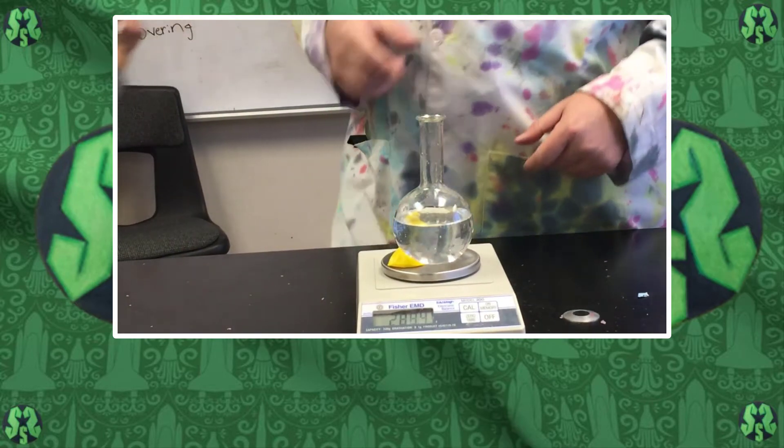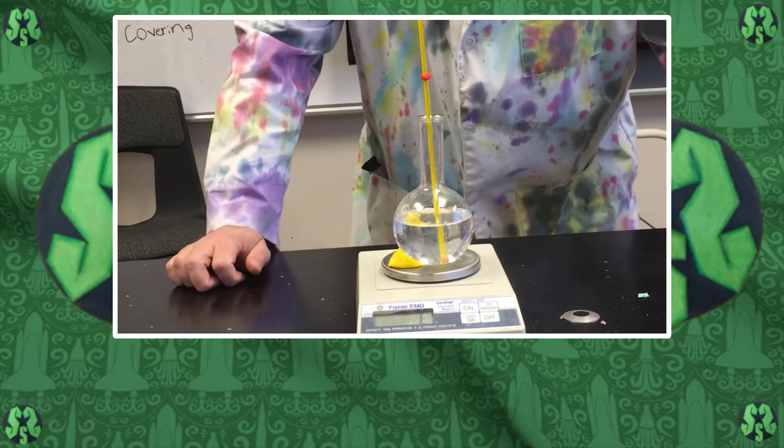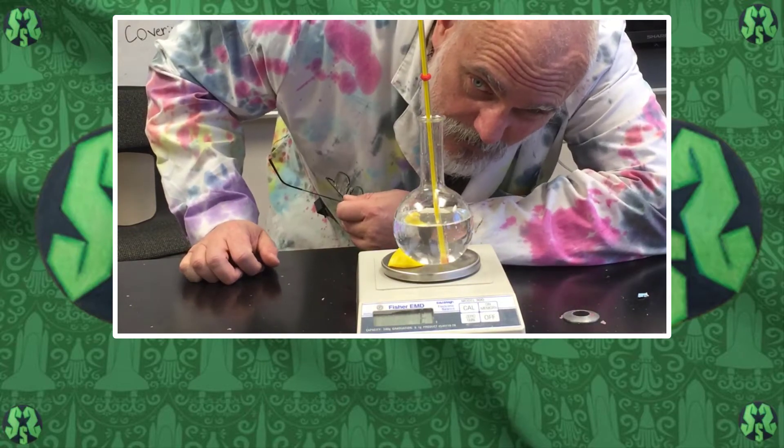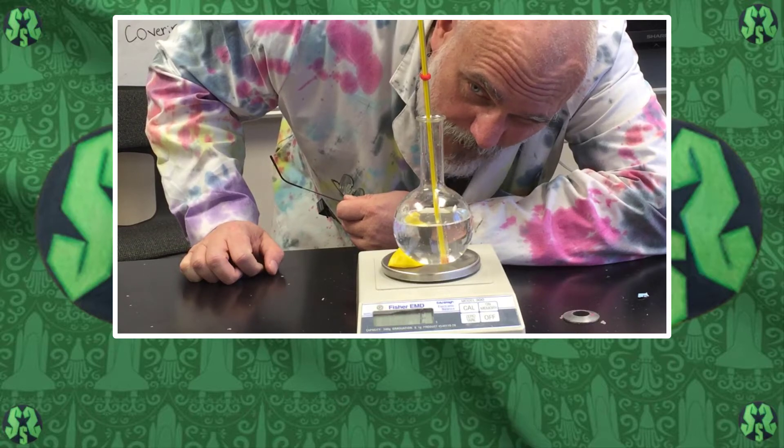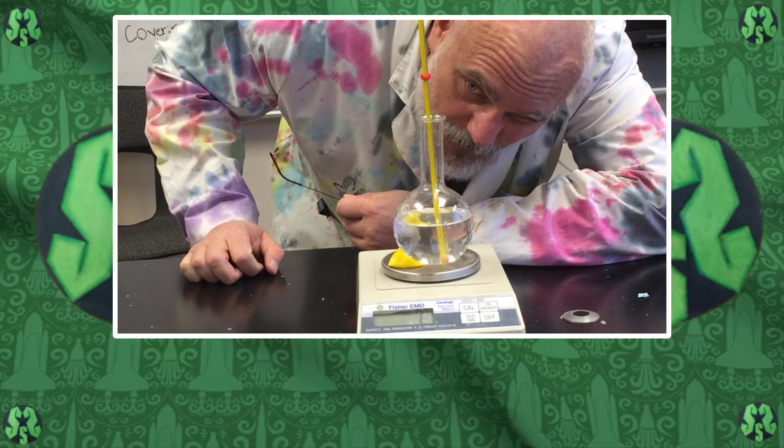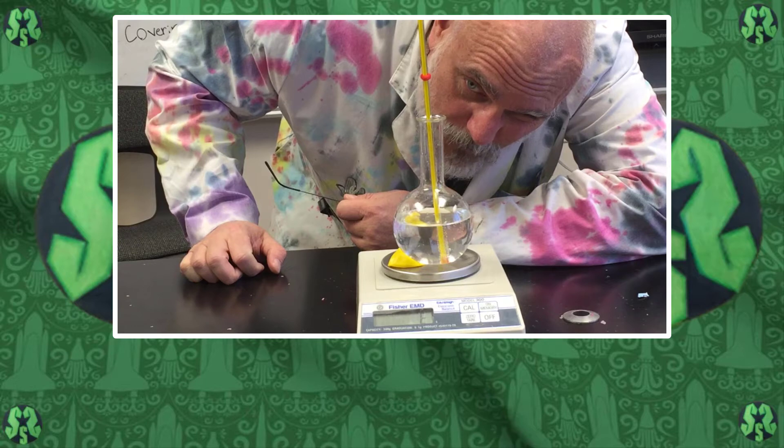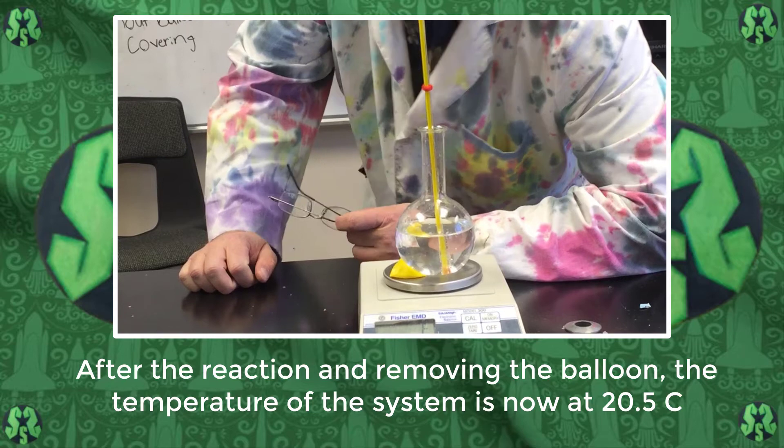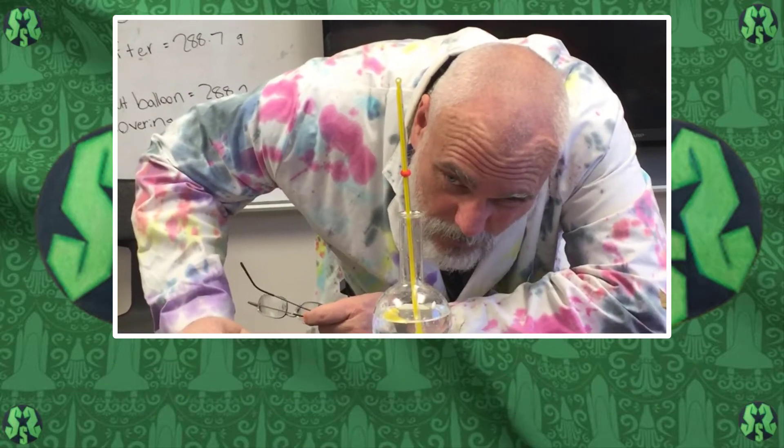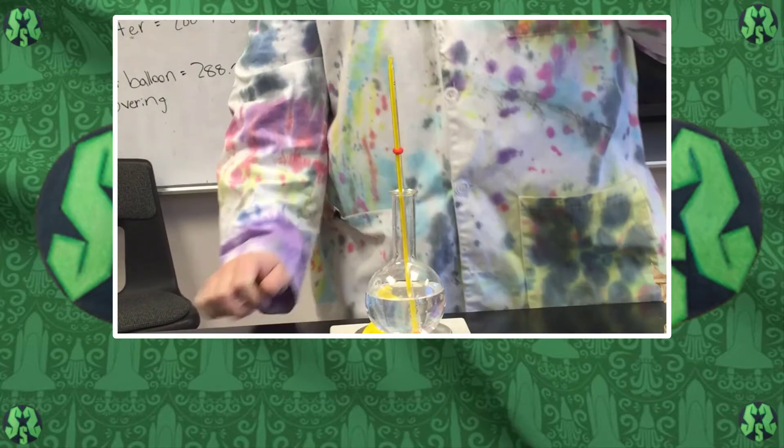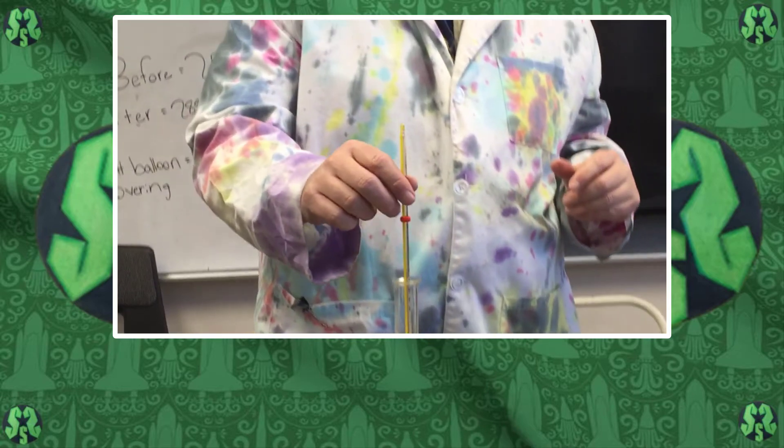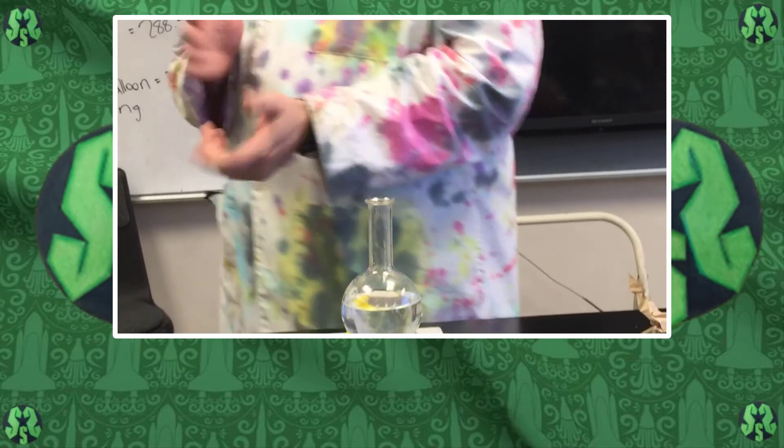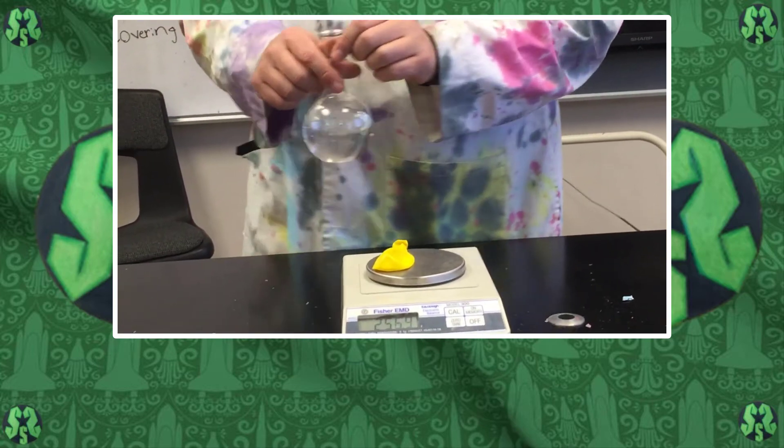We're getting the temperature of it now, and the temperature reads slightly over 20 degrees. So we had 22 before, so probably about a 1.5 degree temperature decrease. Let's let this sit again for about 10 minutes and see if we can get rid of some of the gas.